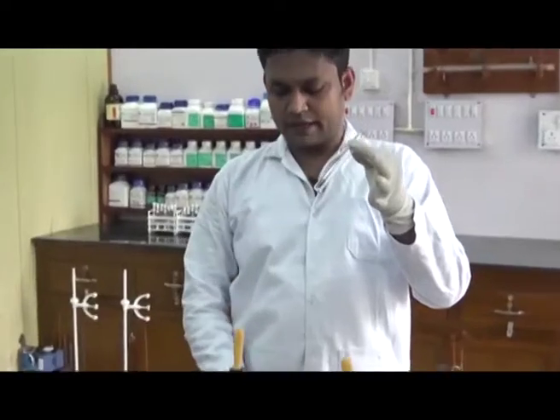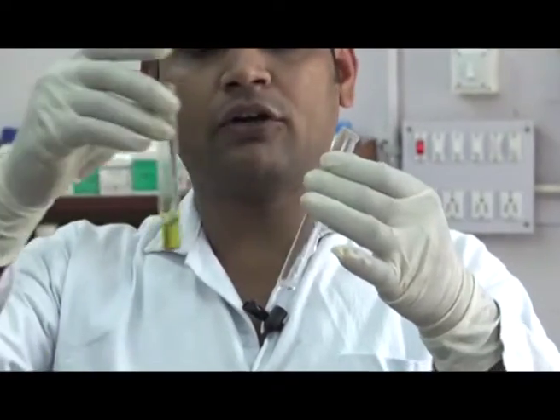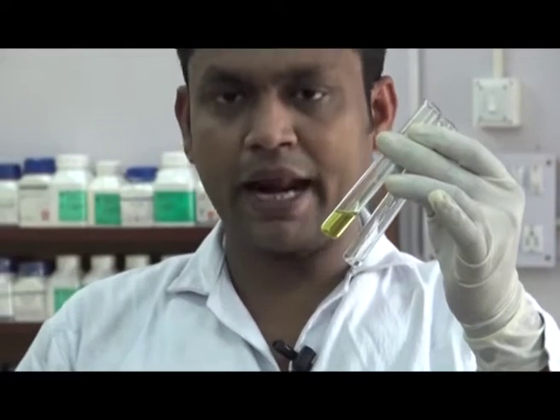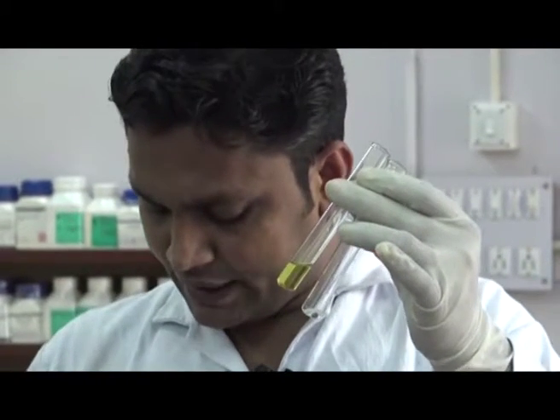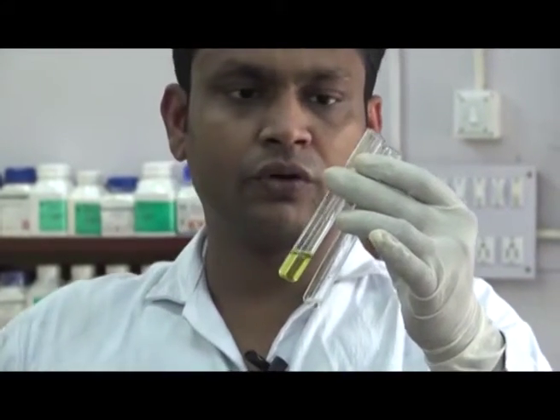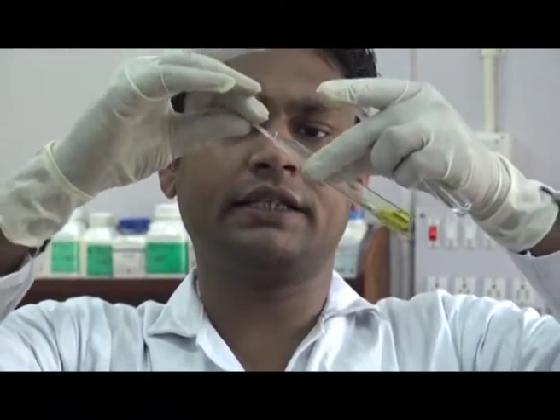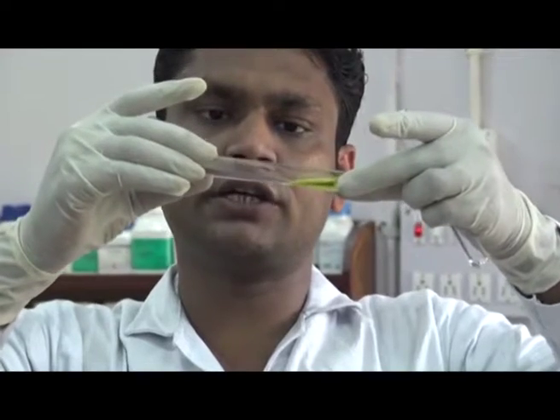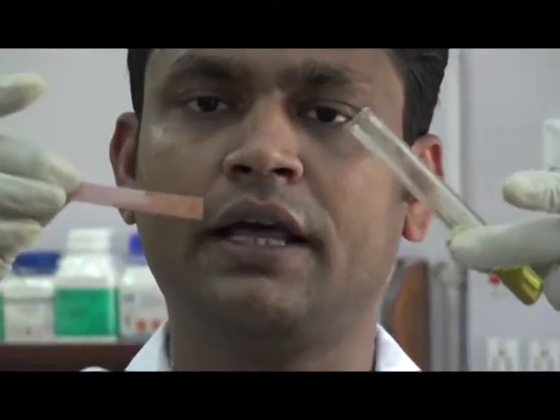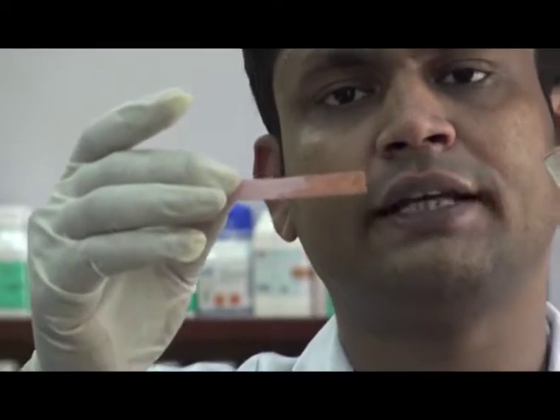We take an aliphatic amine, that is ethylamine, and on the other hand an alcoholic solution of an aromatic amine, that is paranitroaniline, and test the two solutions with red litmus. For the aromatic amine, we can see that there is no significant change in color. The red litmus remains red due to its less basicity.